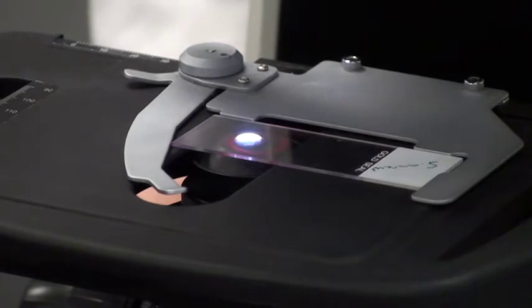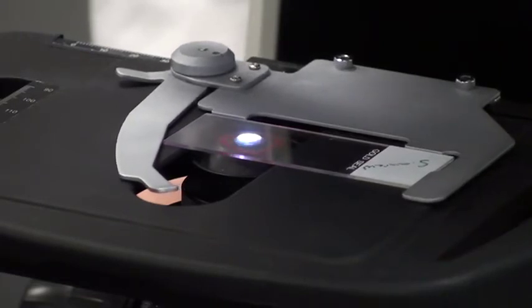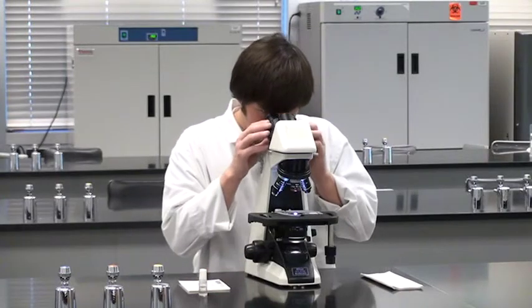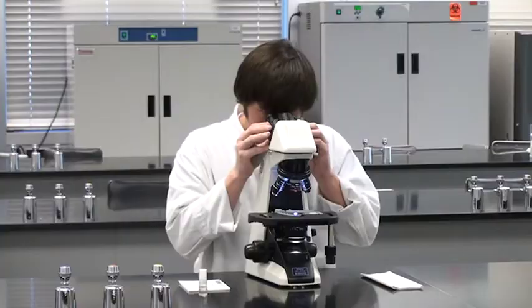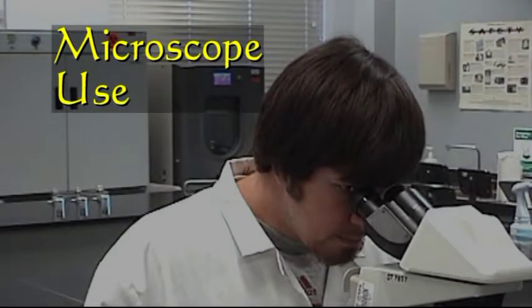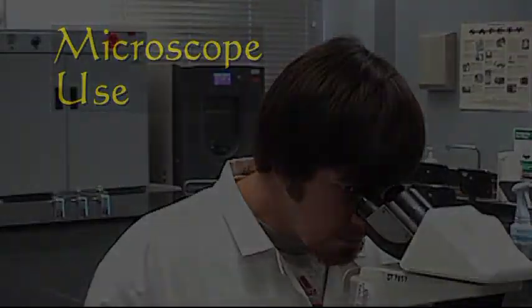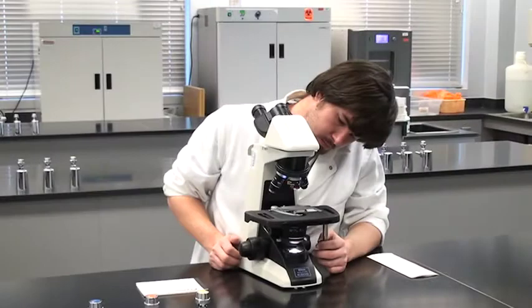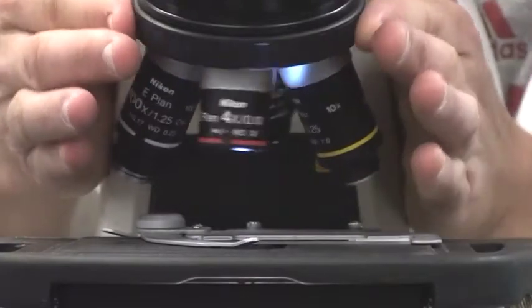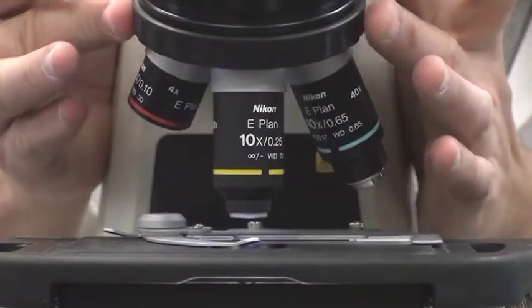If the specimen is stained, you may see the light change color. Now that setup is complete, let's examine a specimen. To find a specimen, verify that either the scanning objective or the low power objective is in position.